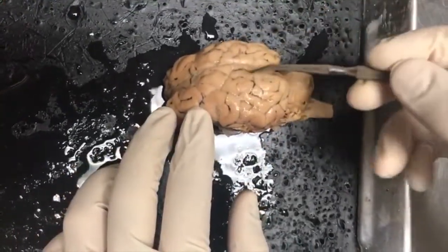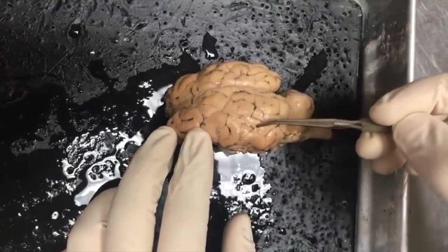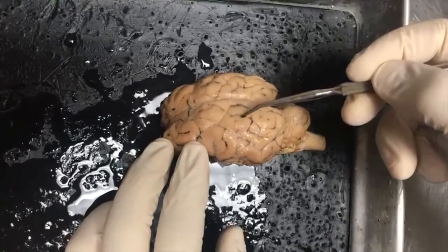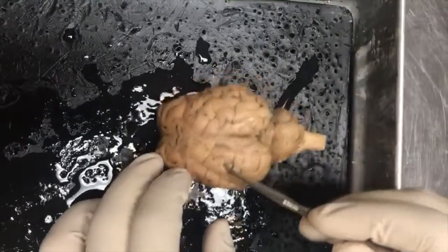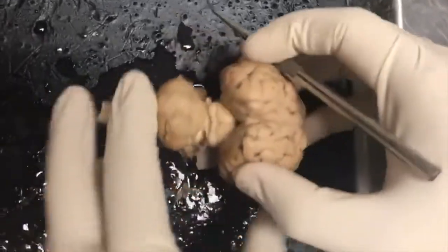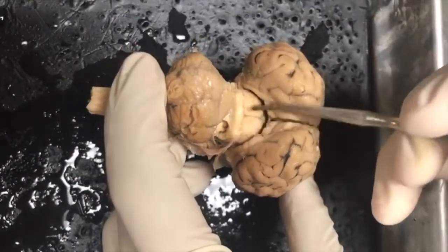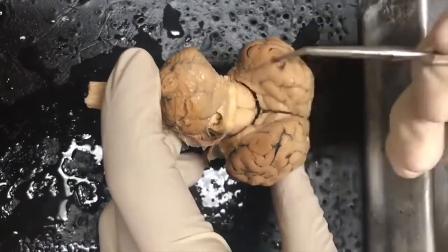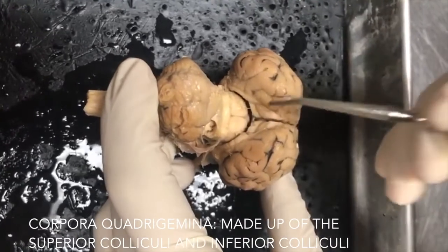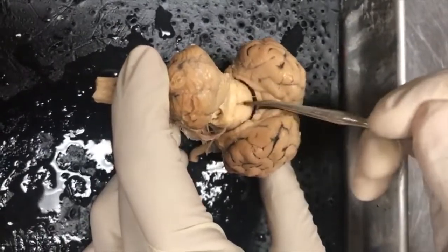On the cortex, you have these noodle-like things, and then the spaces in between them. So the noodles are a gyrus, or multiple gyri, and the space in between them is a sulcus. Alright. So as we move away from the cortex, you could start to see a couple other structures. Back here, you could see the superior colliculus, or colliculi, and inferior colliculus. Collectively, they'll make up the corpora quadrigemina, and they're part of the midbrain.